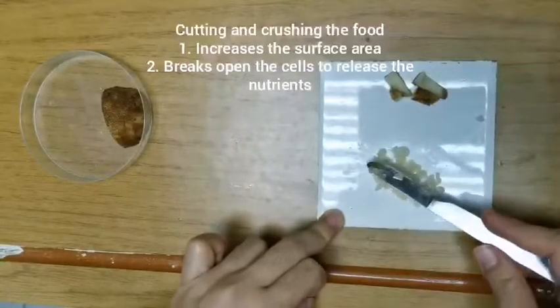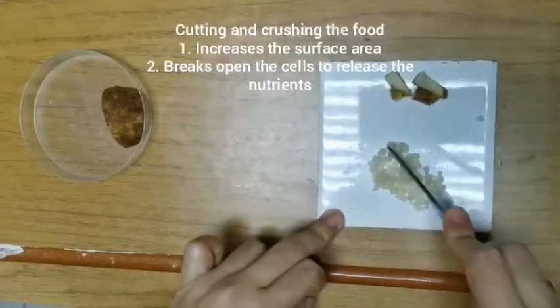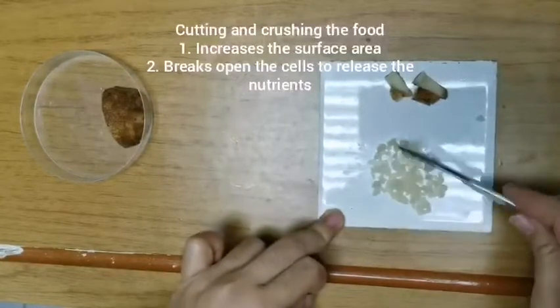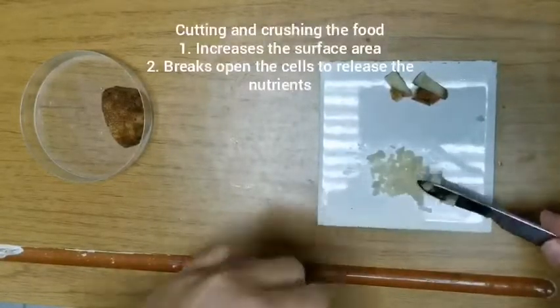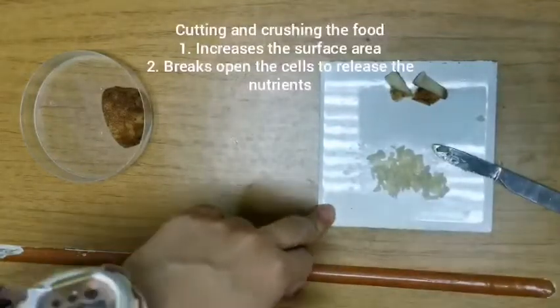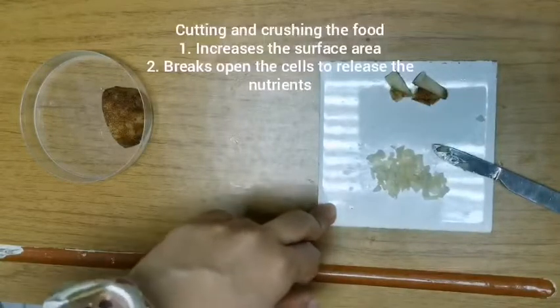That's one thing. The other reason is we also want to break down as many cells as possible, because these nutrients are found inside the cells. So we want to break the cell wall, we want to break the cell membrane to release those nutrients so that we can test for these more easily.